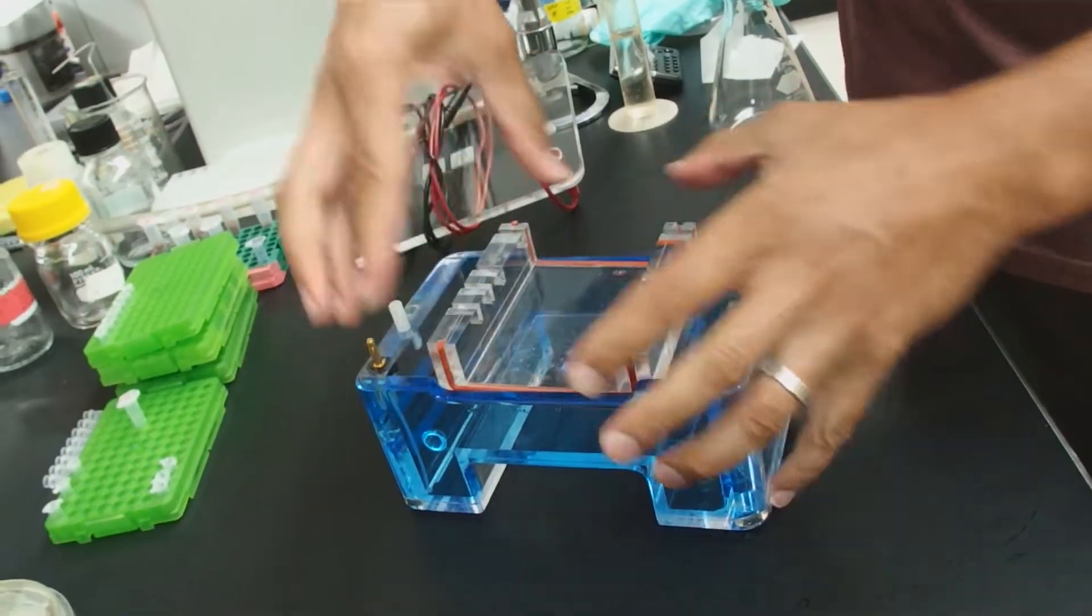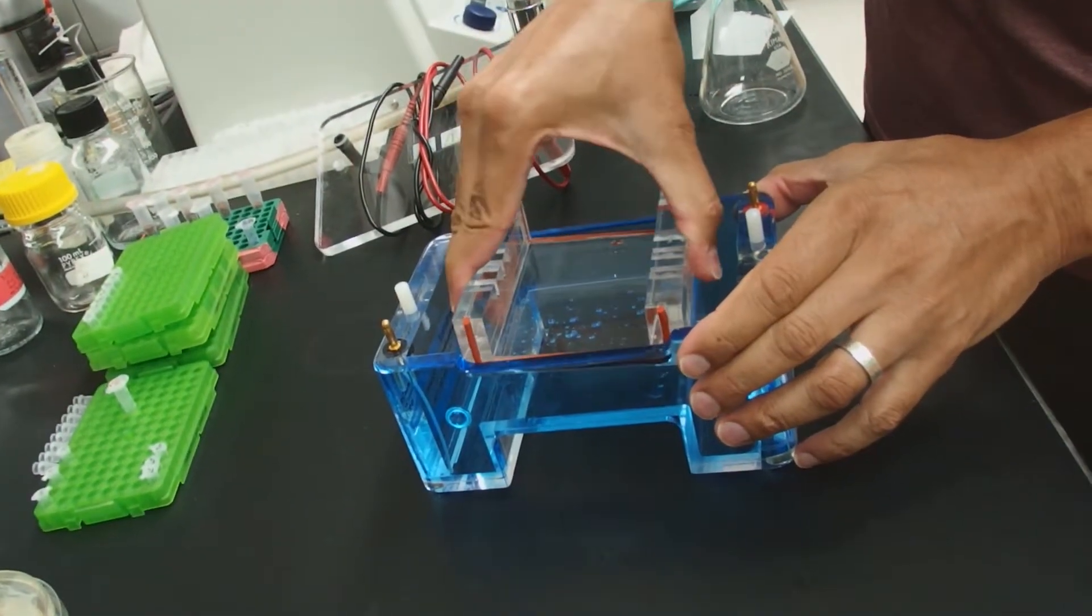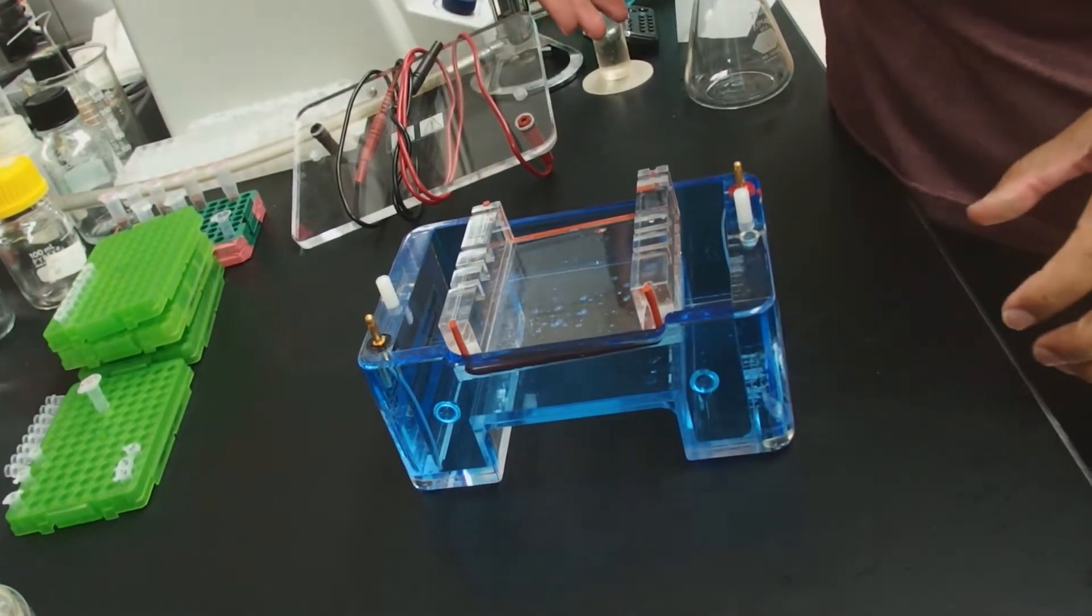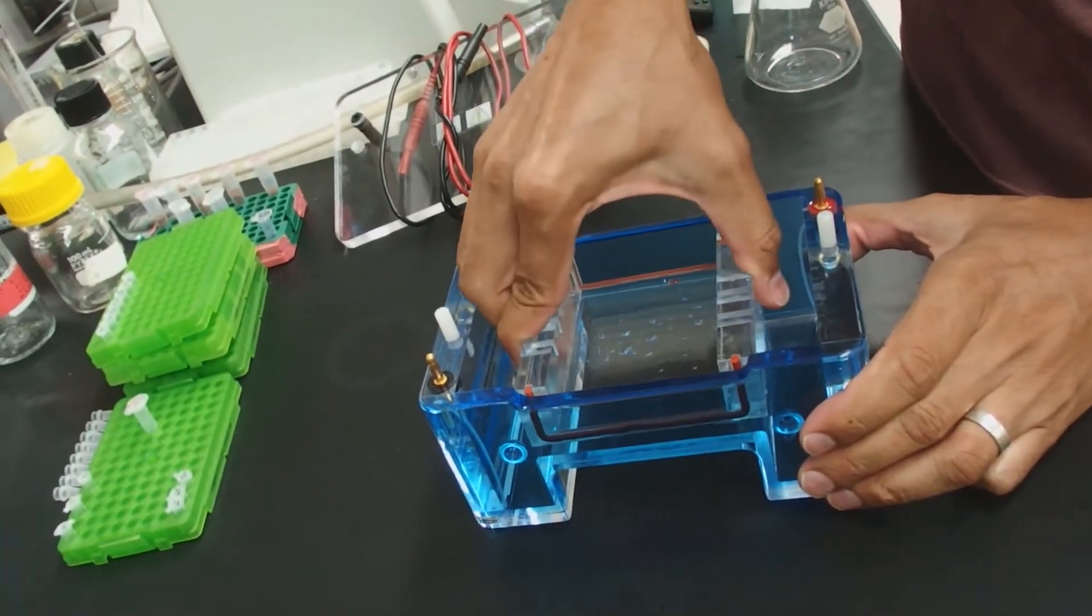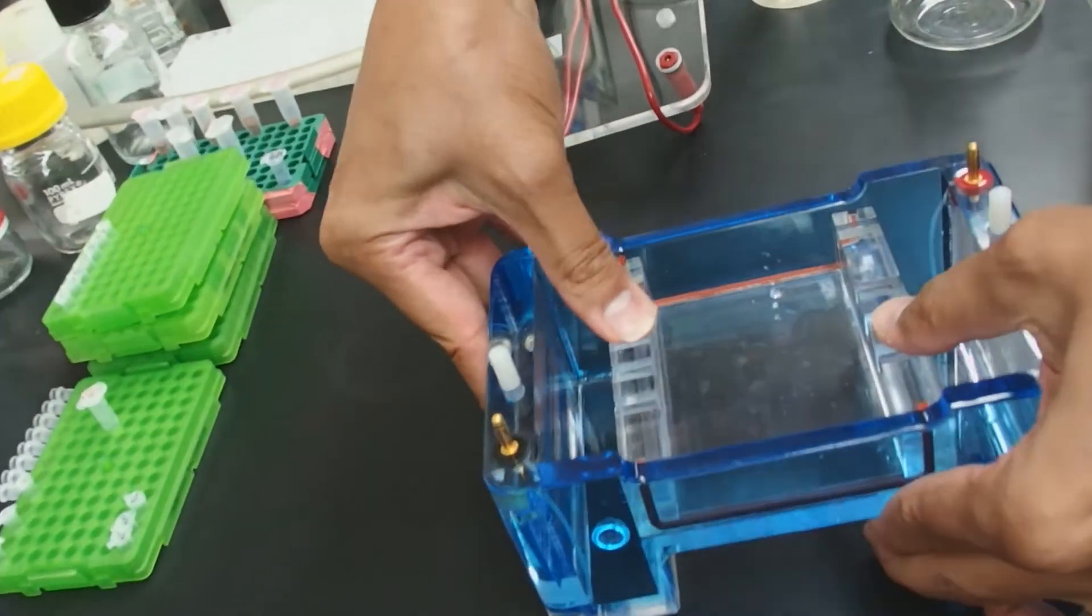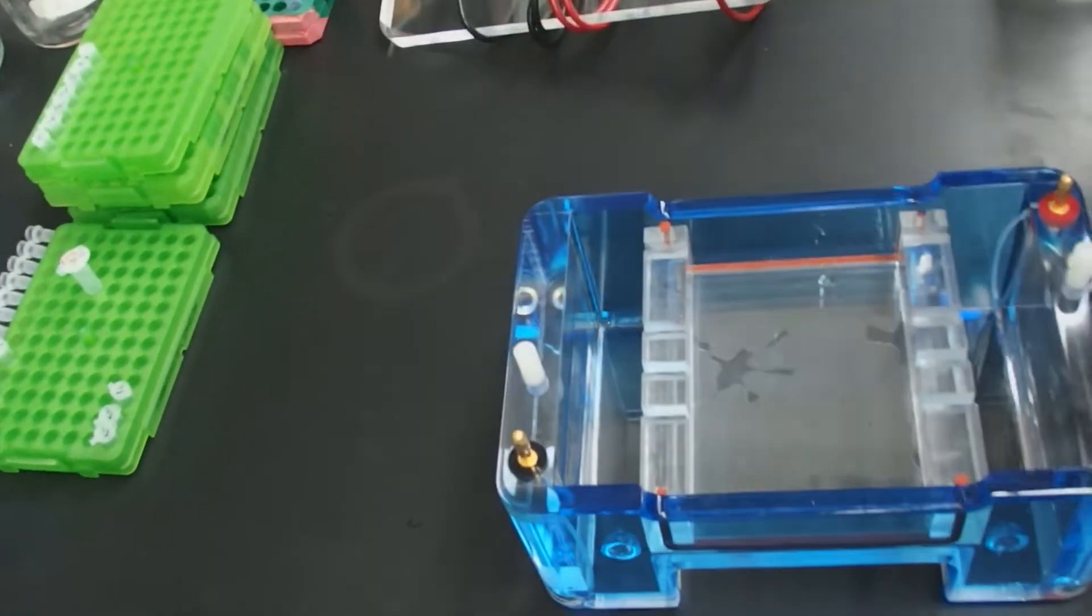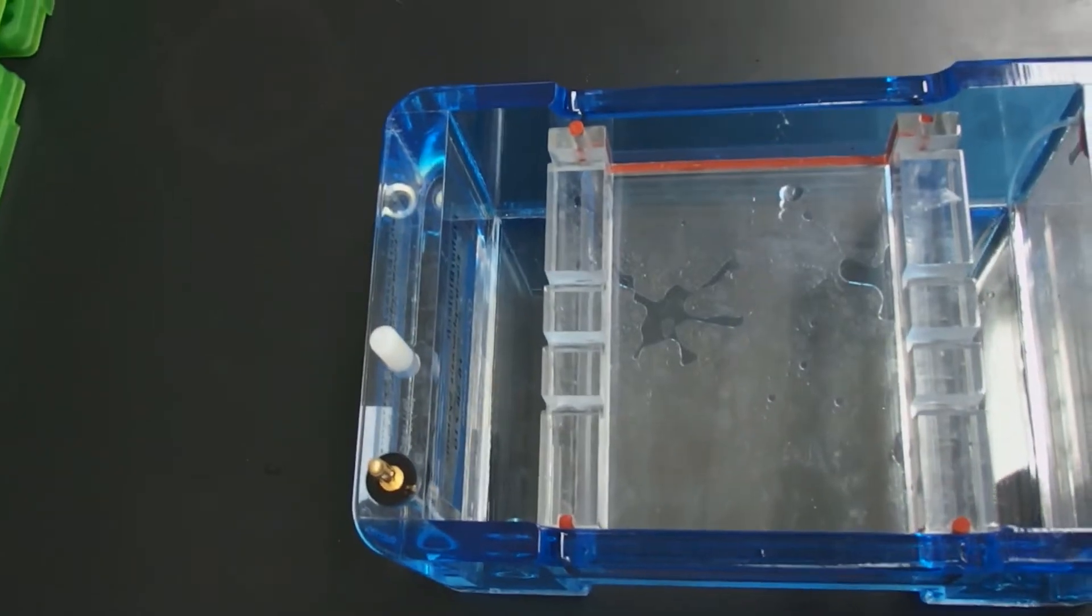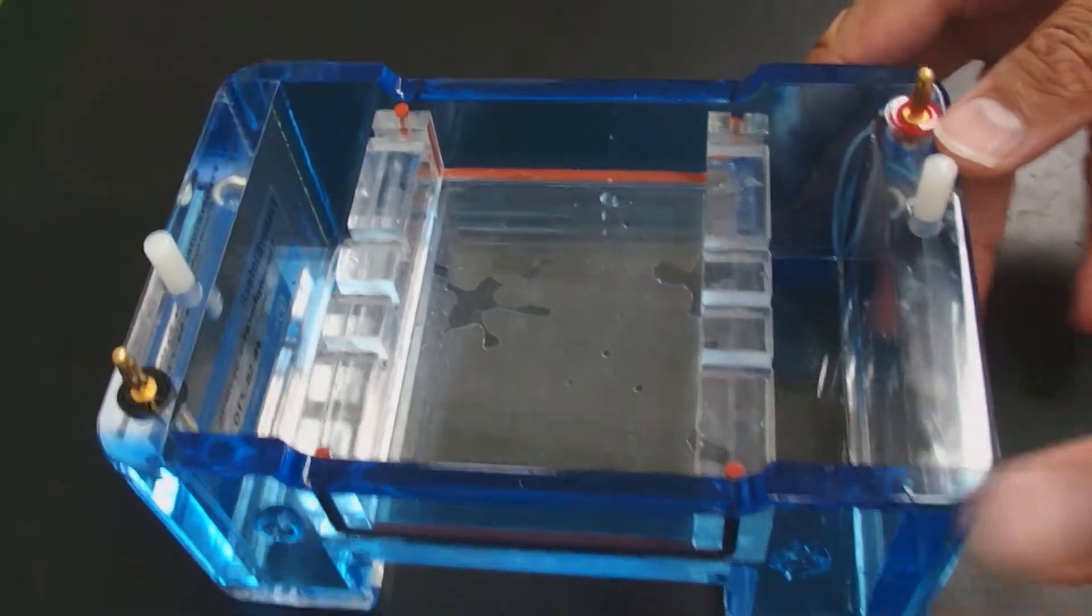I'm going to try to get it started by using your fingers here, and then I'm going to wiggle this in. And you'll see this time it looks like the gasket is not getting bent out of place. Then we're going to press down hard so that it's level. It's important to be level.